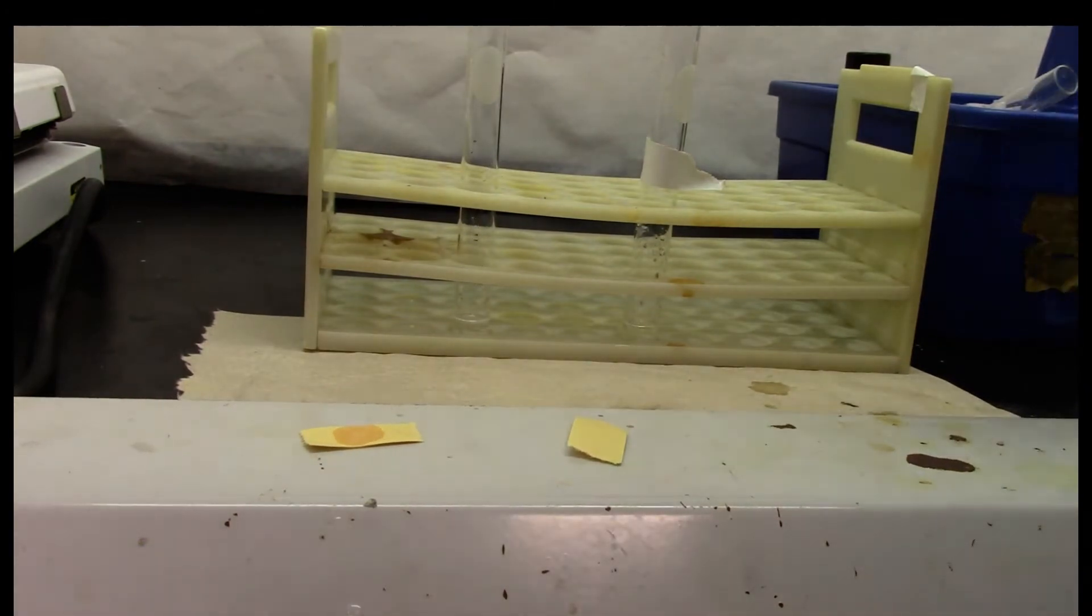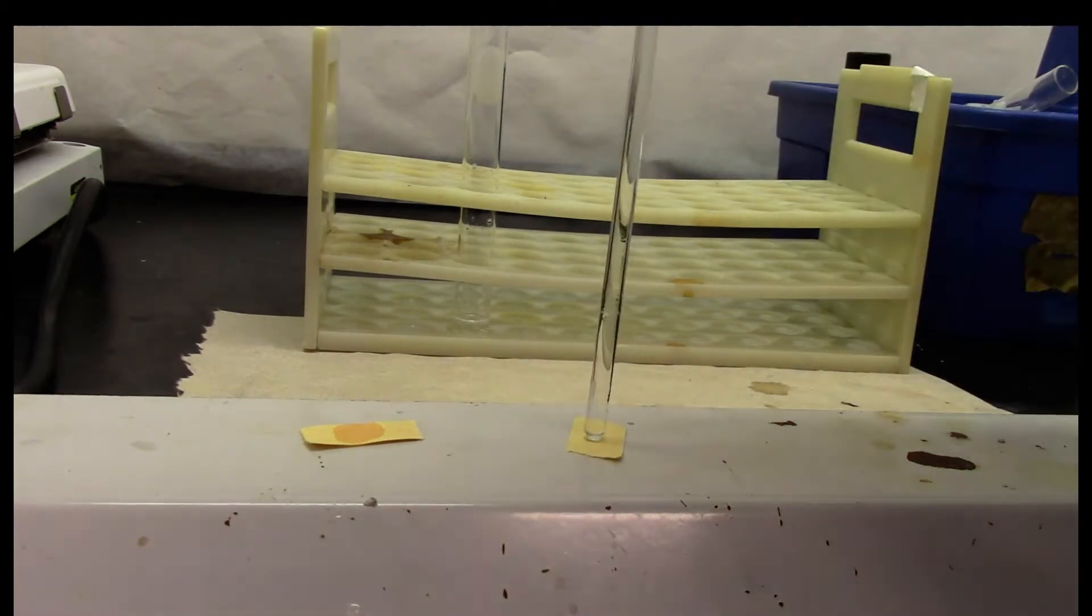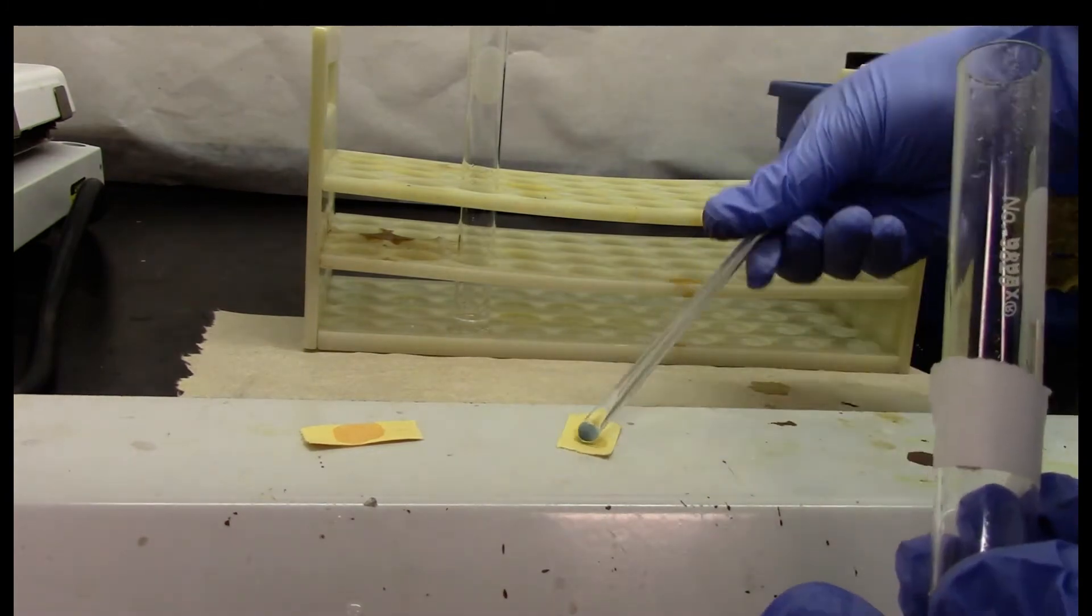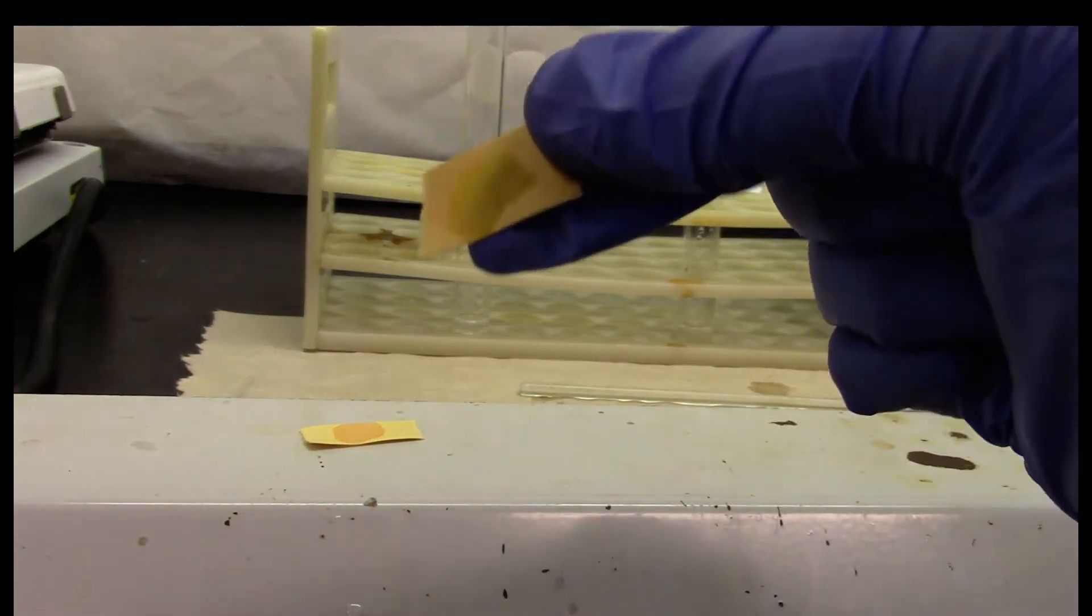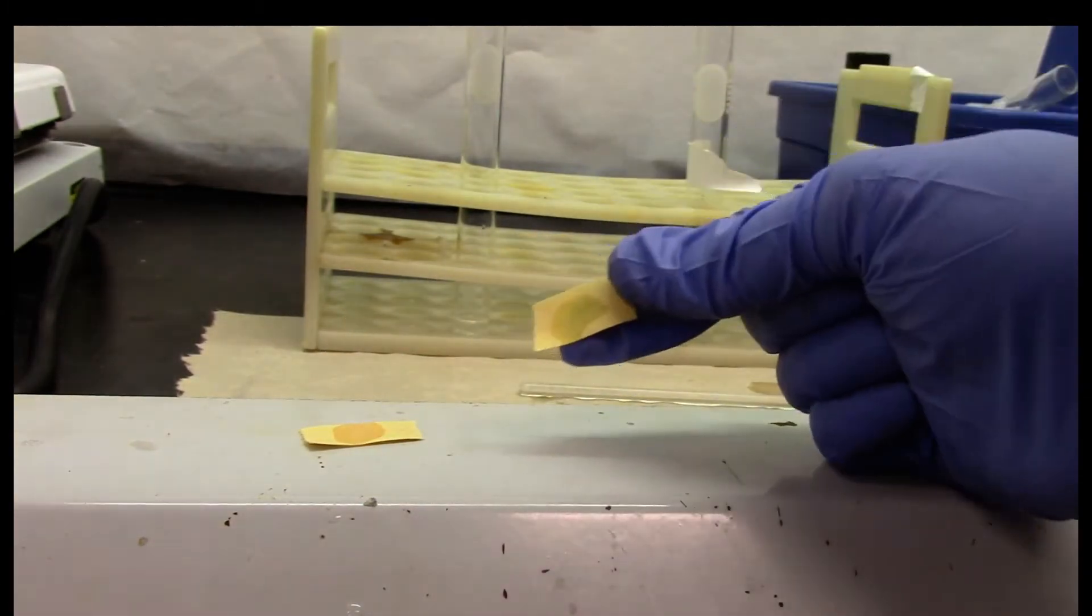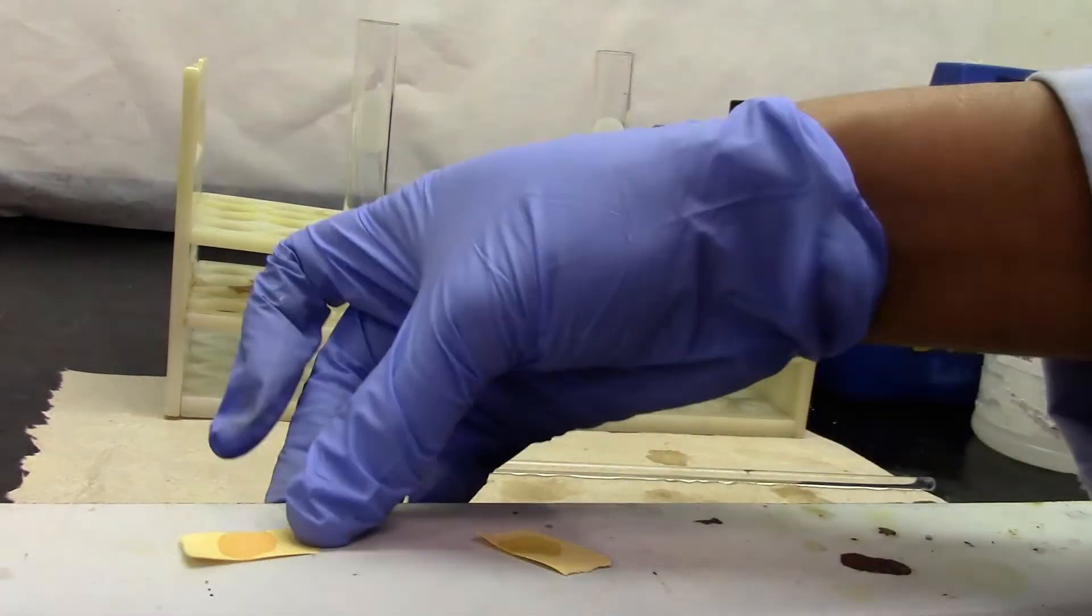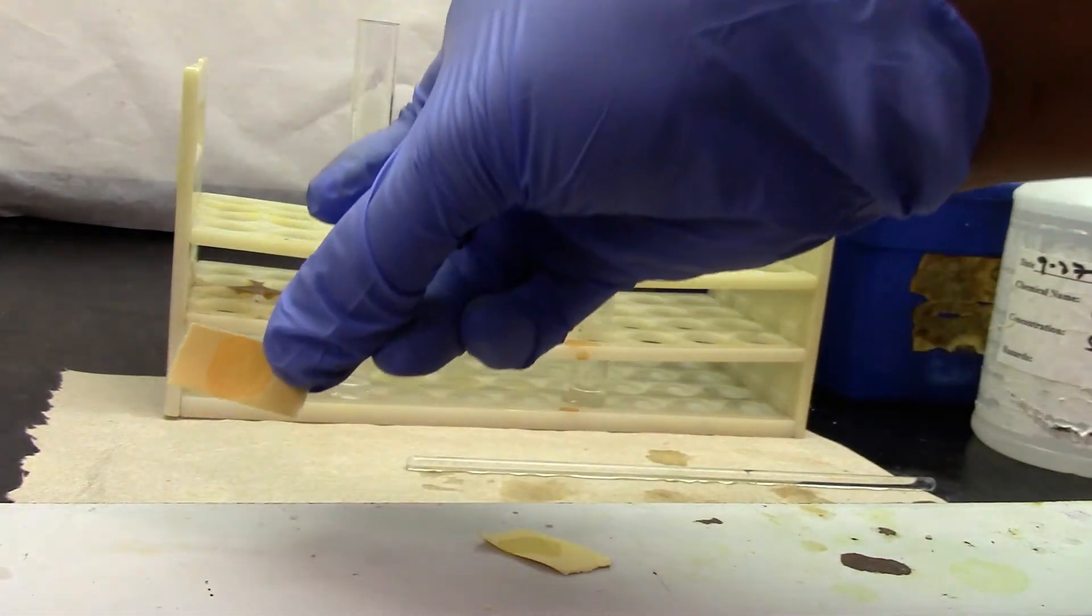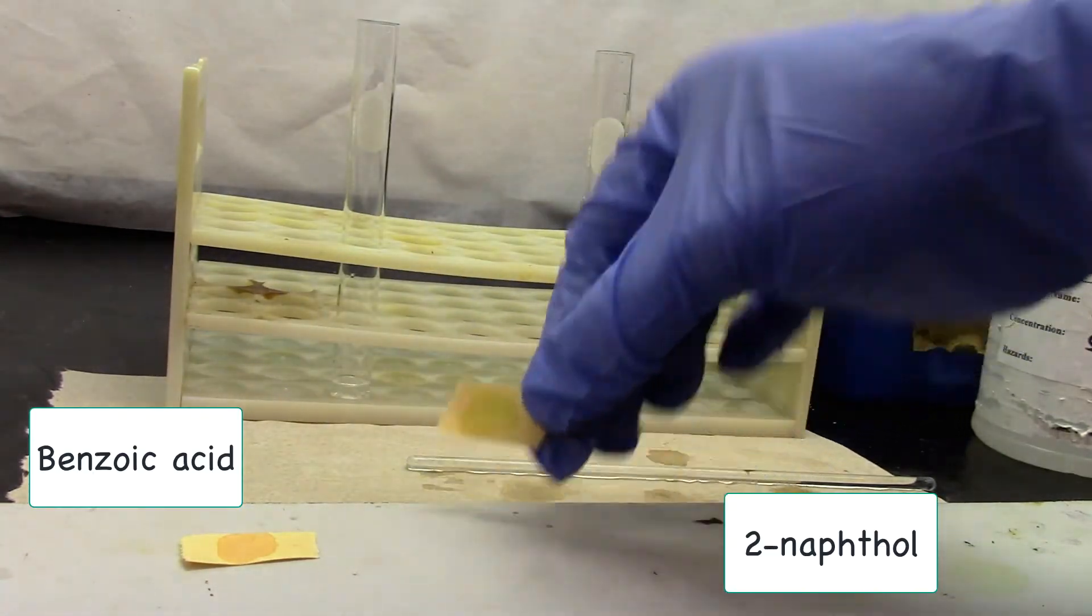Similarly, I am going to try the same thing with the beta-naphthol that I have as my negative test. As you can see, this did not turn pink. Compared to this and this, this is definitely pink. It indicates acidity. This is not.